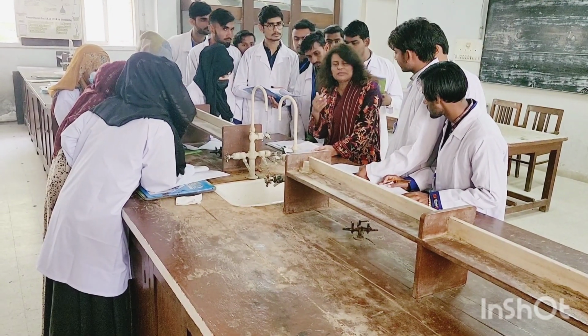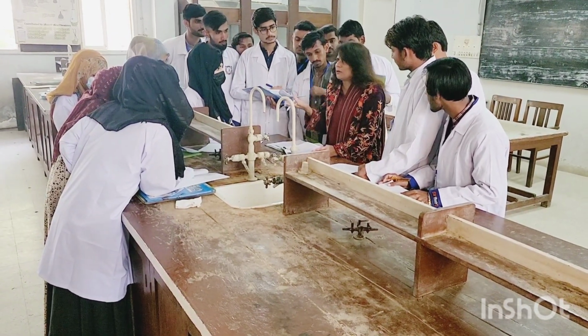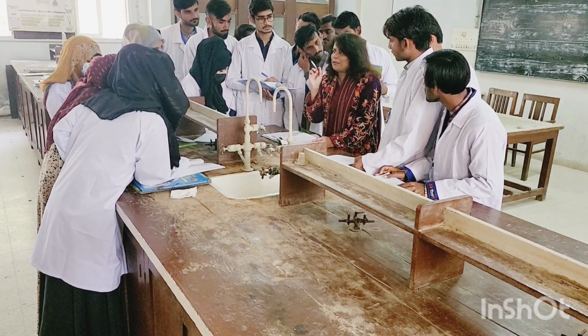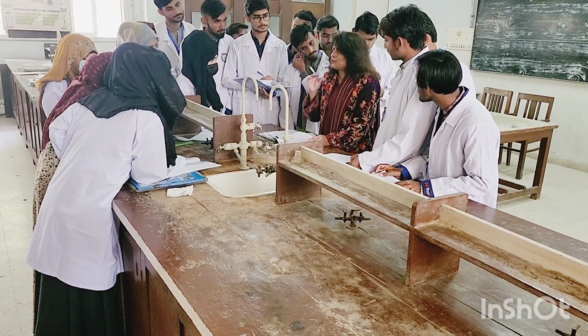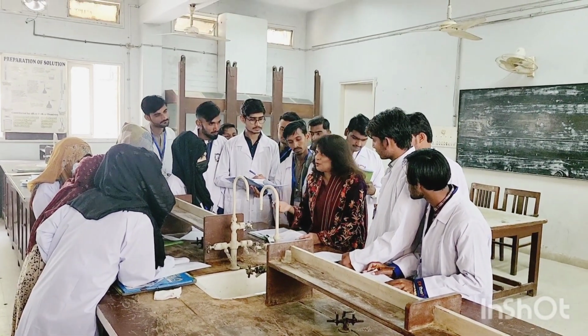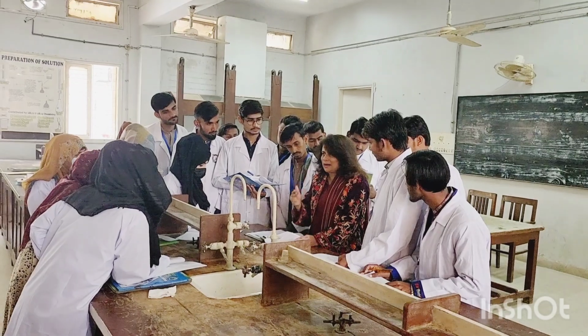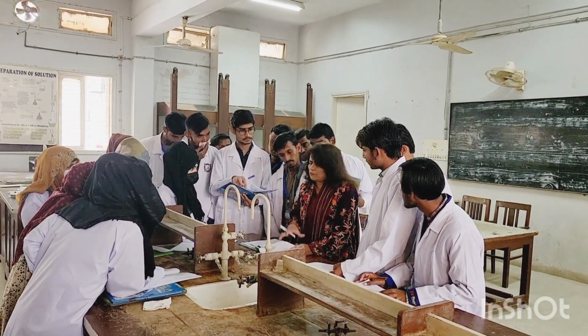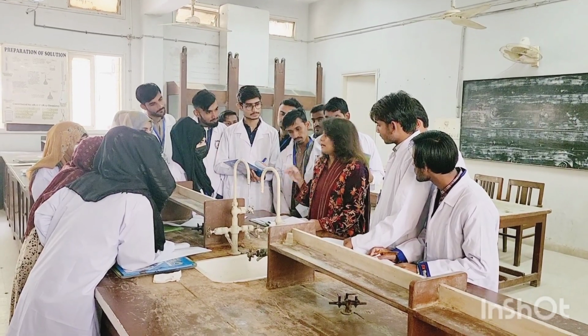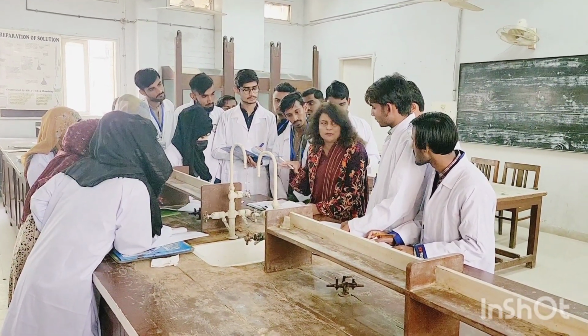Now, you must keep this in your mind. Why water? Water means distilled water, right? Only 2 ml, because we always start from the very first solvent we come across. Though water is not an organic solvent, if water is not available, though water is there in every lab, you can use ethyl alcohol. We'll go for the ethyl alcohols.